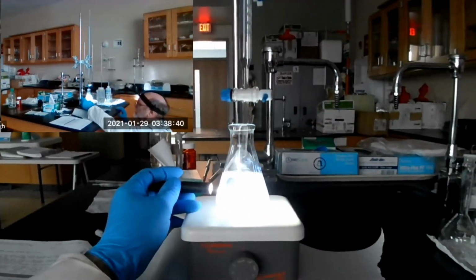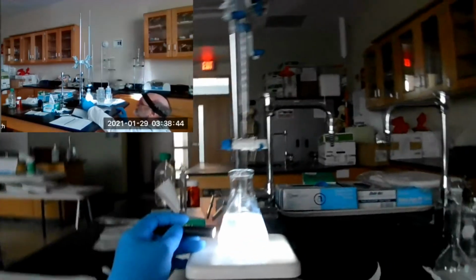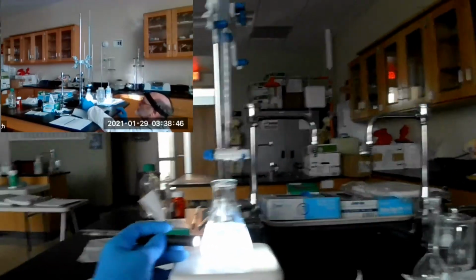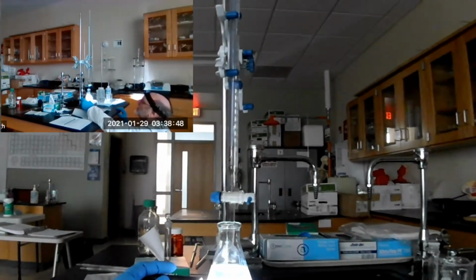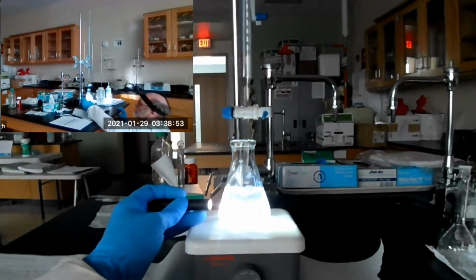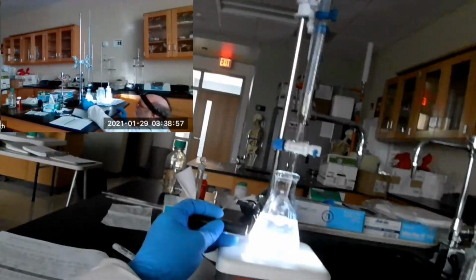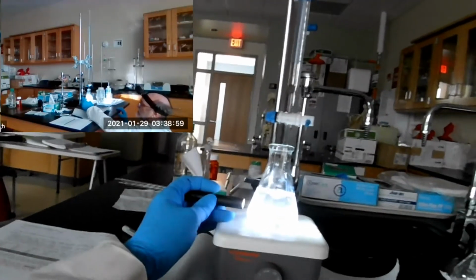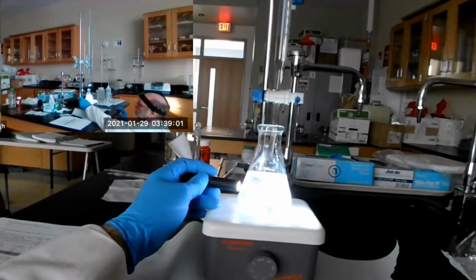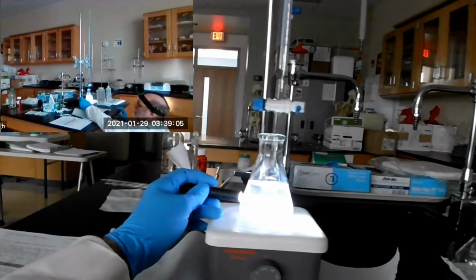There we go. You can see the light beam. I can see the light beam. I hope the camera catches it. This is the first time I've ever recorded this particular procedure, so I'm not sure how well the camera's going to show it. That's why I'm taking pains to narrate. What do I see? There we go. That's a better one. I can see the light beam very clearly.